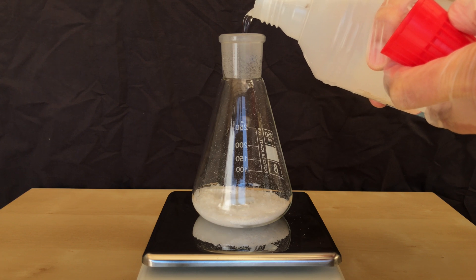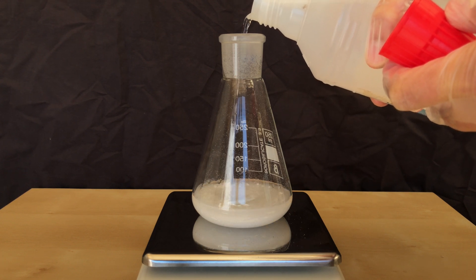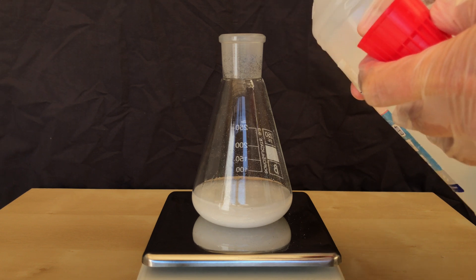Adding water to sodium hydroxide is generally a bad idea and it should be done the other way around. If you do this, it could lead to boiling, splashing, lye everywhere.